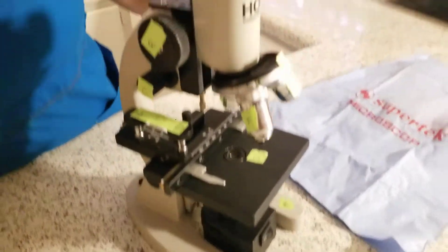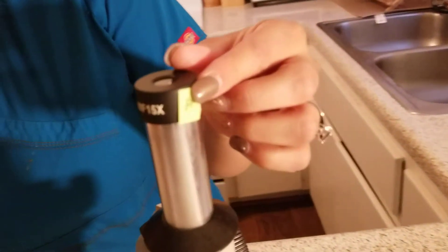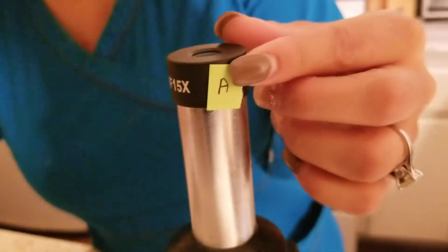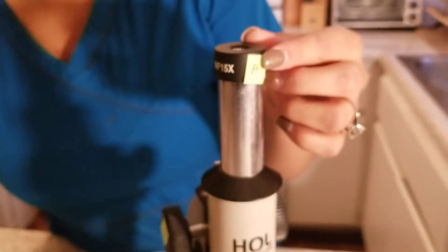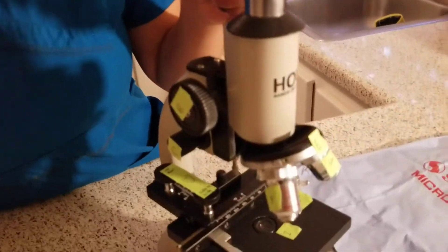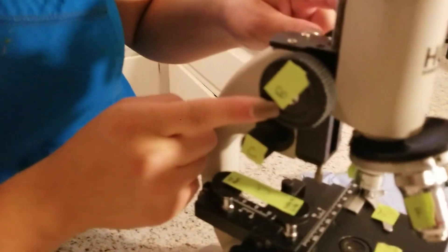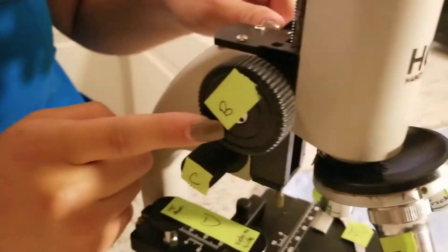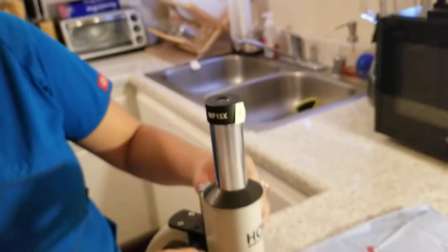The first one will be the ocular lens, which is part A. It's the eyepiece of the microscope, and the maximum magnification is going to be 600. Next will be the coarse adjustment knob. This moves the eyepiece up and down to focus on slides.